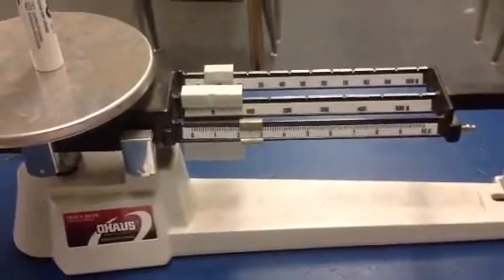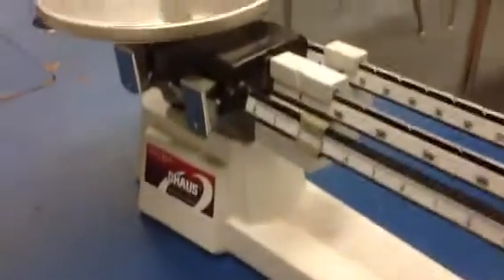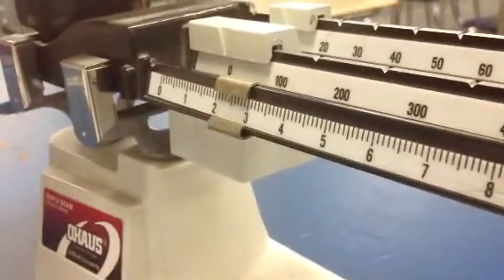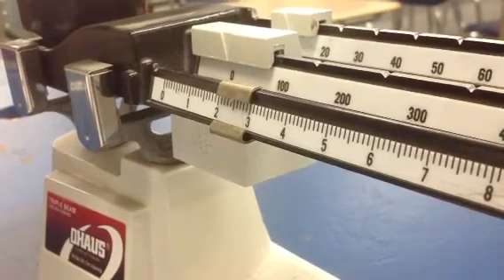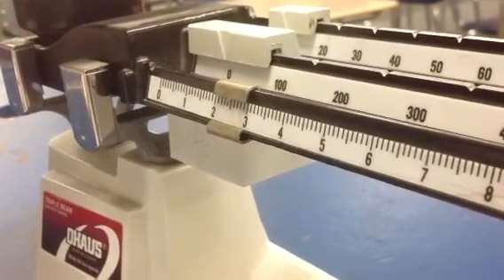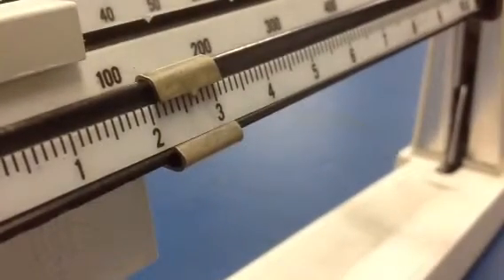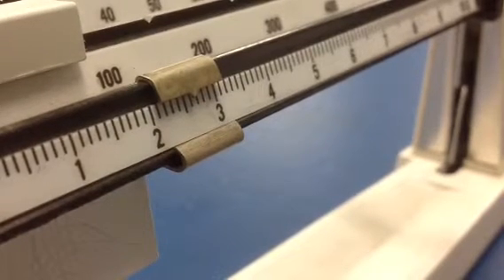But let's just say I'm sitting at the lab bench and I don't really feel like being in the front, so I'm just kind of over here. If I look at this device from over here and try to take a reading, I'm going to zoom in here. I'm going to say this looks to me like the answer is about 2.41 grams. Now, if I were on the other side here and I looked at it, I'd say, no, you know what? That looks a little bit more like maybe 2.66 grams. And neither one of us is correct.